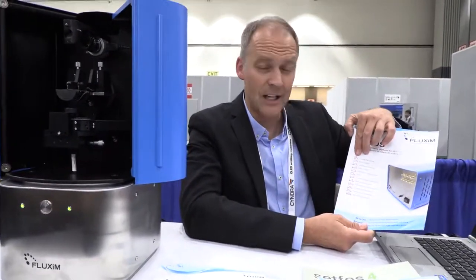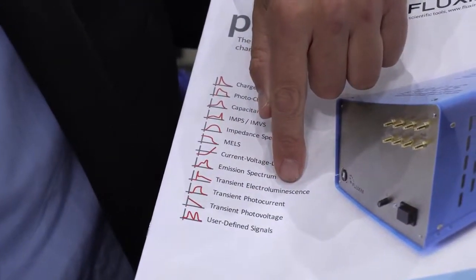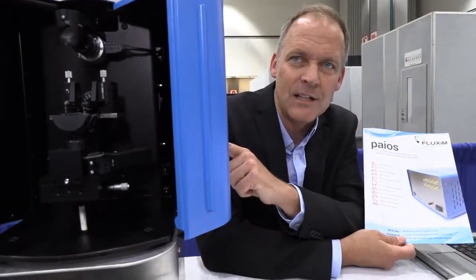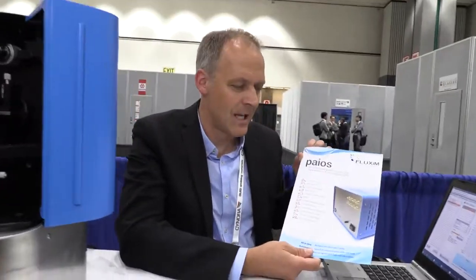What's the main difference between that and this? The main difference, this is focused on electrical properties of OLEDs, where we only look at, for instance, transient electroluminescence, which measures only the time-dependent light output, and here we have angular resolution of the light coming out. We get the spectrum of light, angular dependence, so it's complementary. This is more optical analysis, and this is more electrical analysis. And what's next?